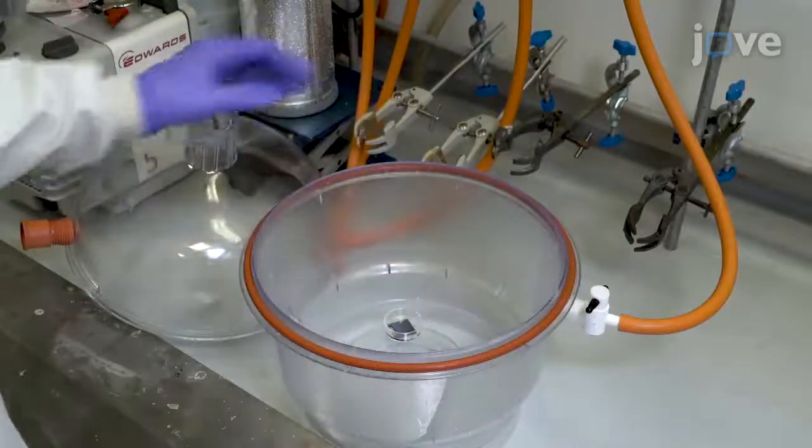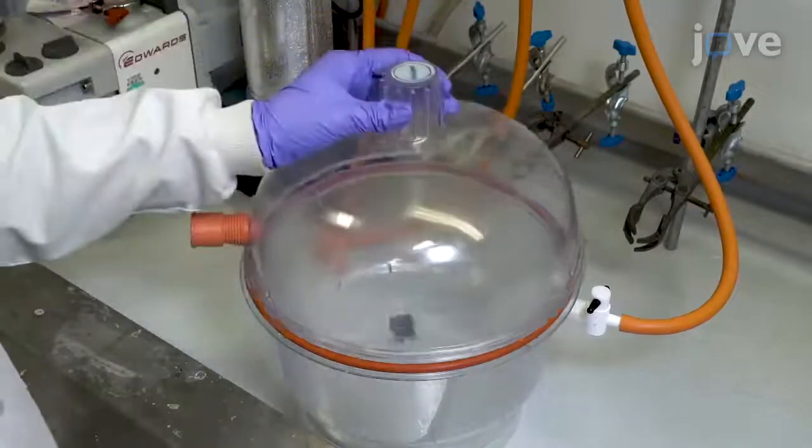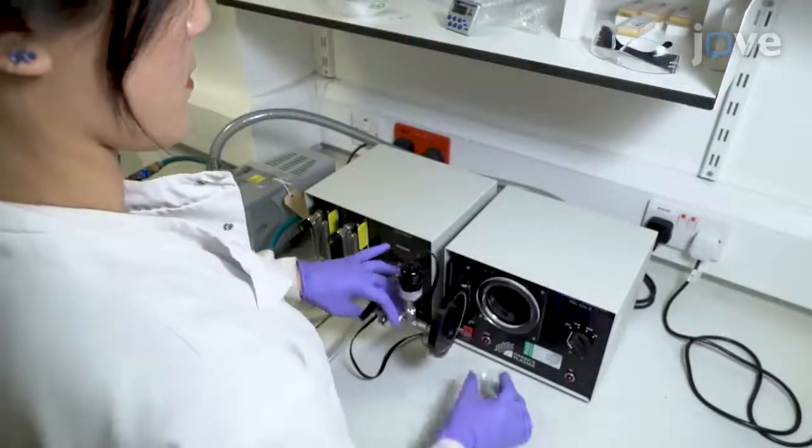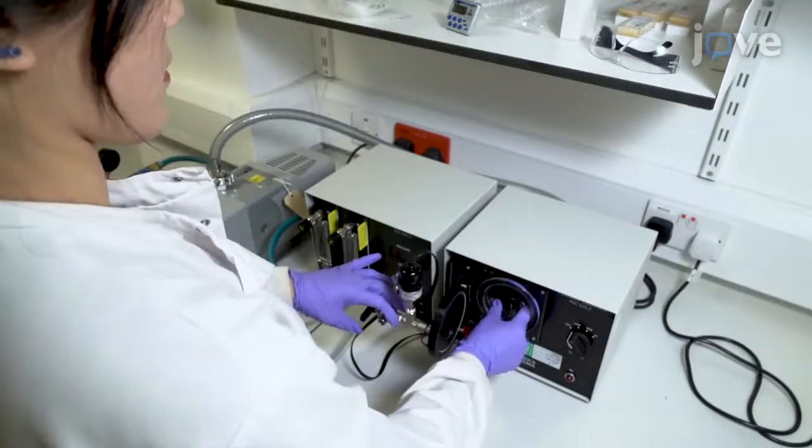Degas the PDMS covering the master for another five minutes. During the degassing, treat a glass slide with oxygen plasma for one minute.